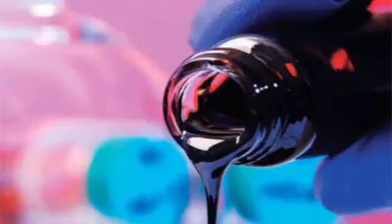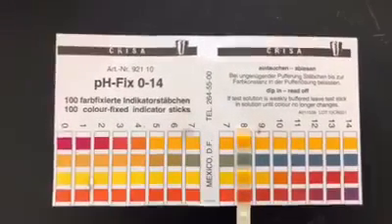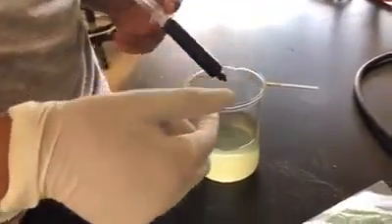We did an experiment based on the situation problem: a spill from a pipeline in Cadereyta Jimenez. We poured 200 milliliters of water extracted from the school's lake into a beaker. Before that, we measured the pH of the water to compare it with our results.